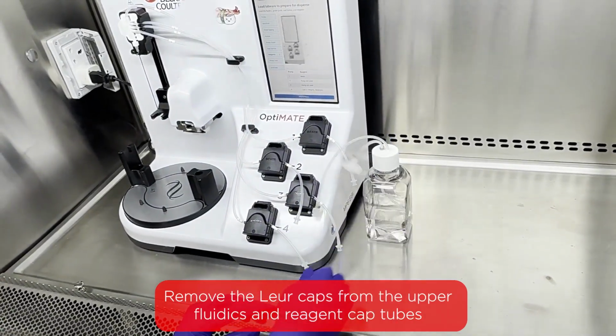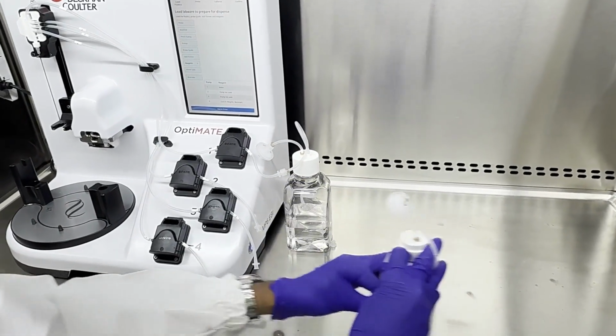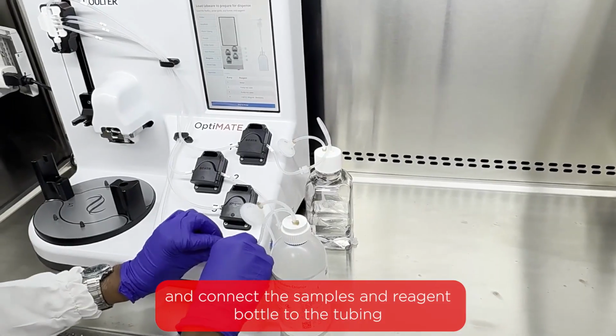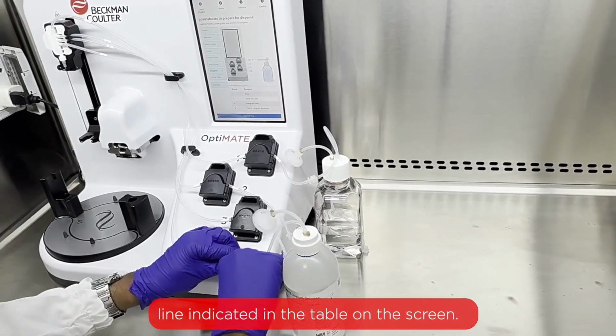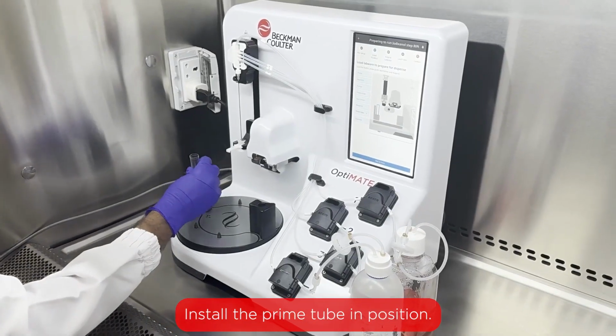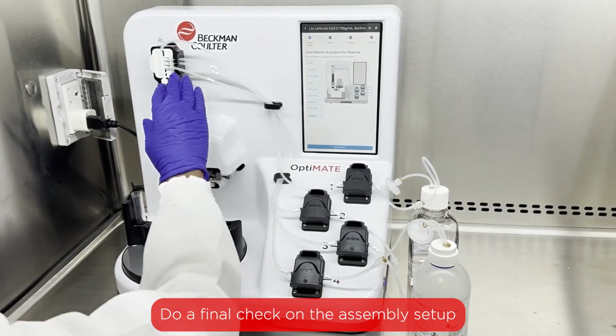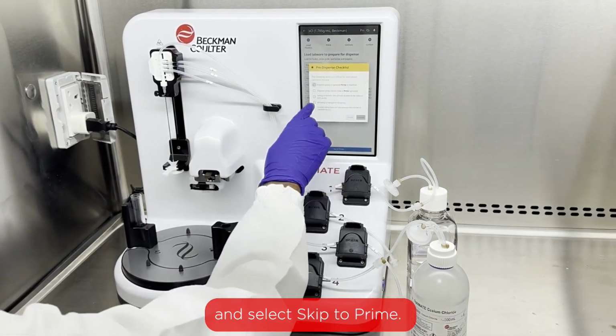Remove the luer caps from the upper fluidics and reagent cap dip tubes, and connect the sample and reagent bottle to the tubing line indicated in the table on the screen. Install the prime tube in position. Do a final check on the assembly setup and then select Skip to Prime.